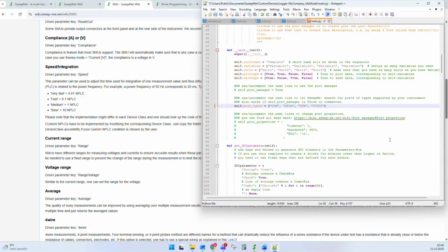And instead of every time writing again into the driver how to make a connection to a GPIB device, we have tried to make this as simple as possible by adding a port manager. If a driver activates the port manager using this line, self.portManager true, SweepMe will open a port for you automatically and hand it over to the driver in the connect phase. So you can start using and writing commands immediately to your instrument. And this is what we, of course, recommend.